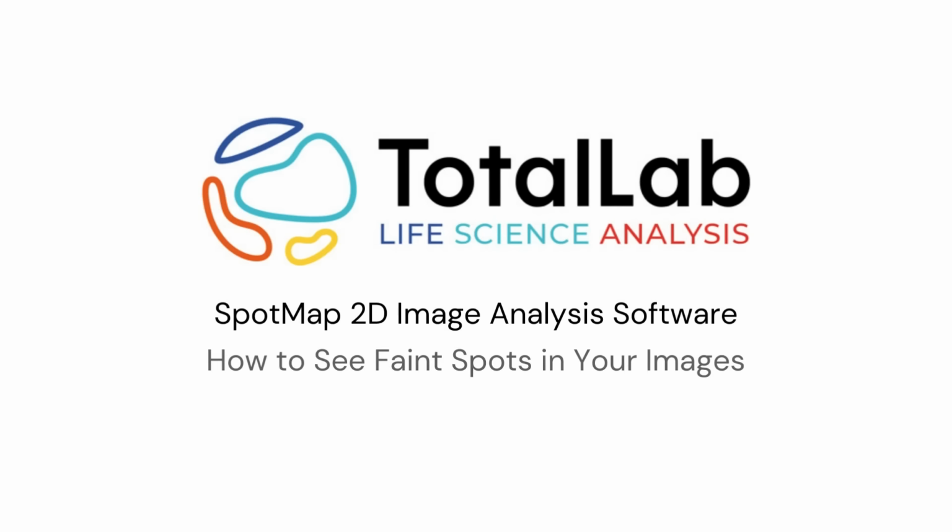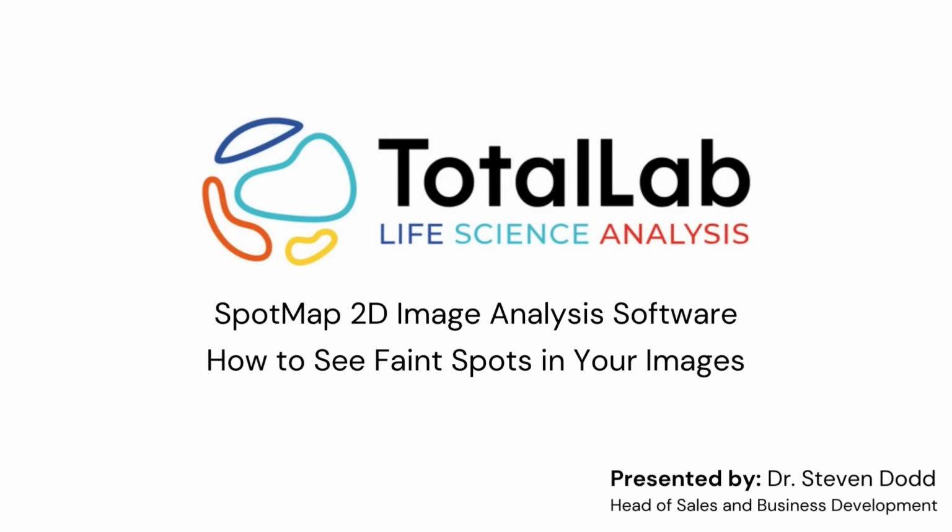Hello everyone. So today I'm going to be showing you how you can use our SpotMap software, or in fact any of our software, to adjust the contrast of your images to allow you to see faint or weaker spots or bands that you might be interested in measuring.